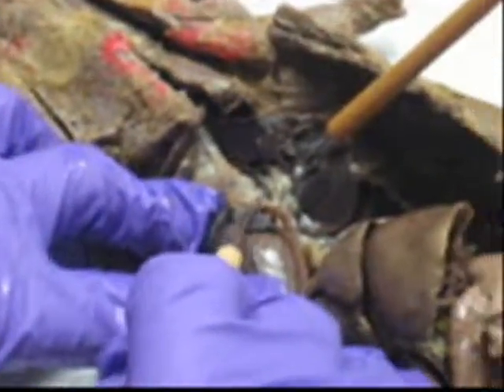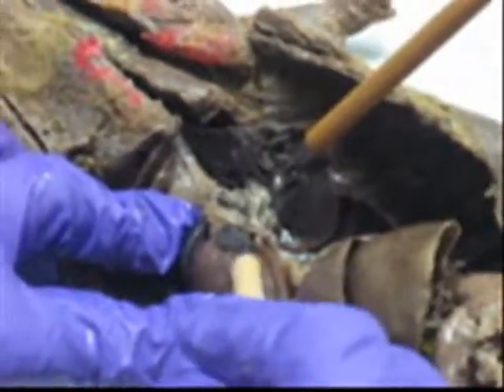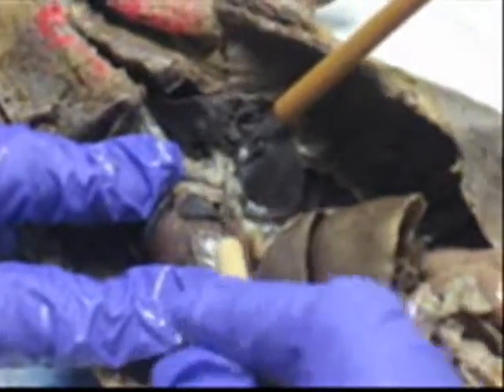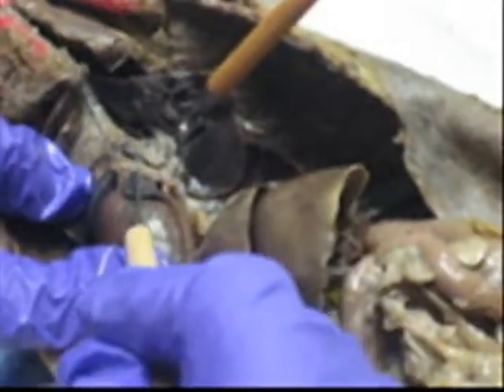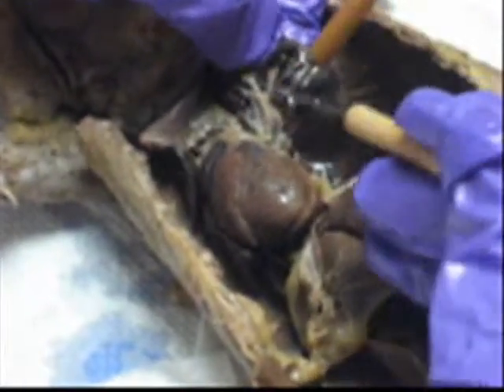This should be red. The vein is highly oxygenated. This here, the pulmonary trunk, and this is the pulmonary artery. Pulmonary vein, pulmonary trunk, and the pulmonary artery. Forget pulmonary trunk. I don't know what I'm saying. I was like, bronchi. All of this is bronchi.